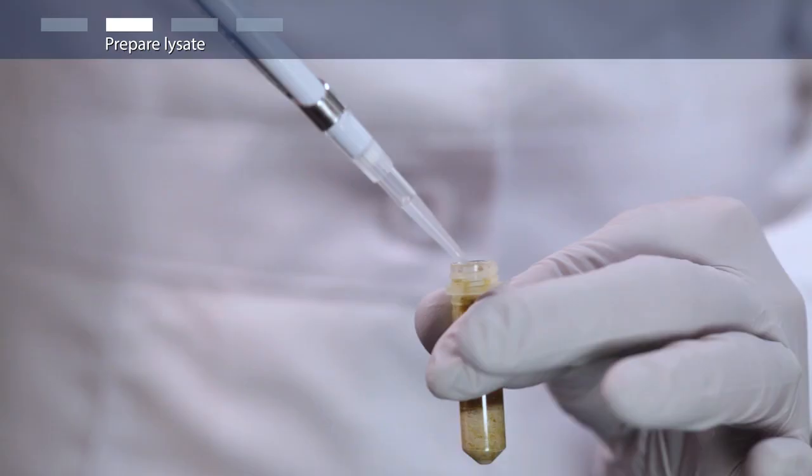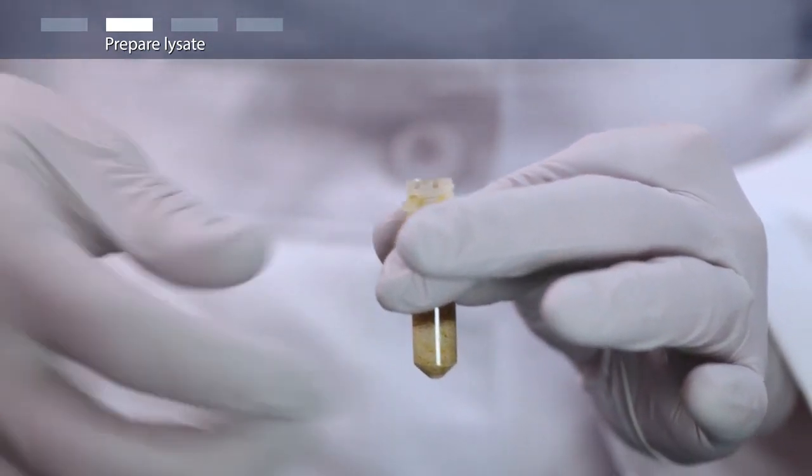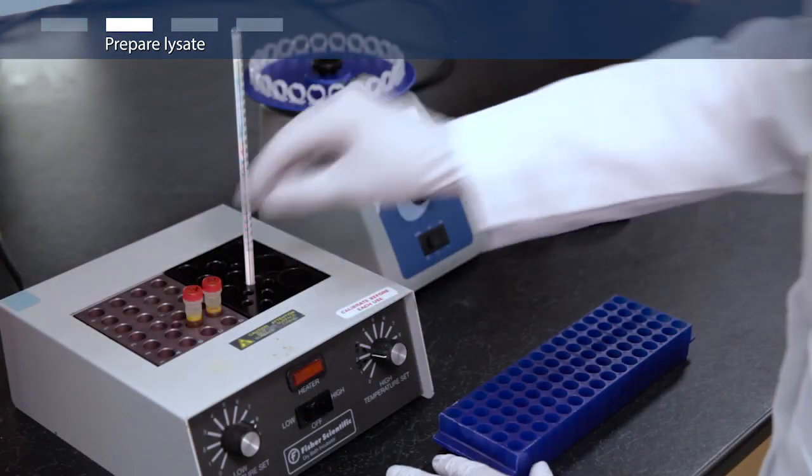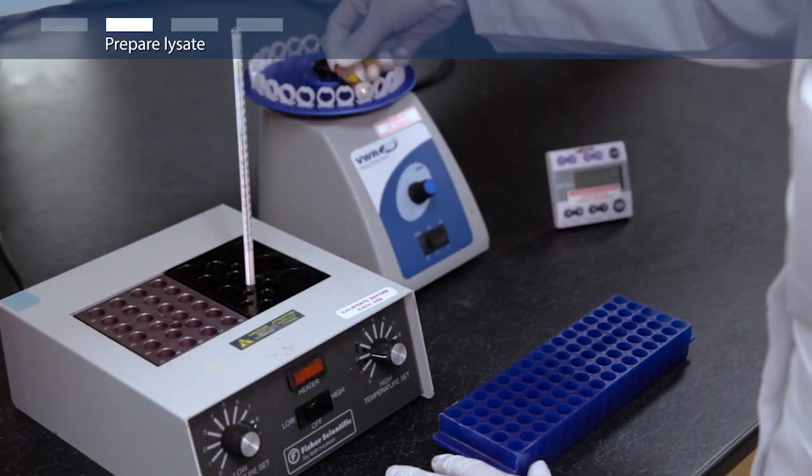Add 100 microliters of lysis enhancer and briefly vortex. Incubate the sample at 65 degrees Celsius for 10 minutes.